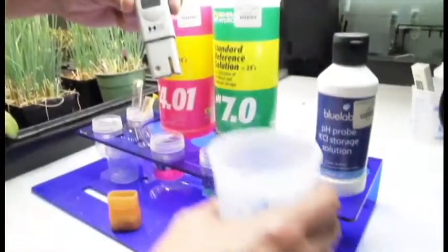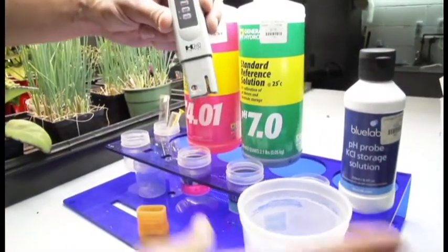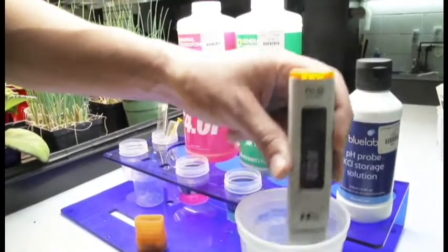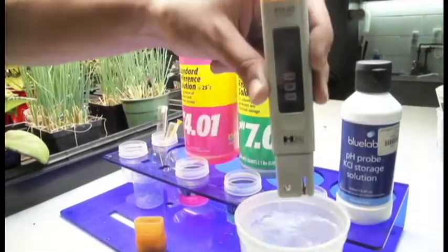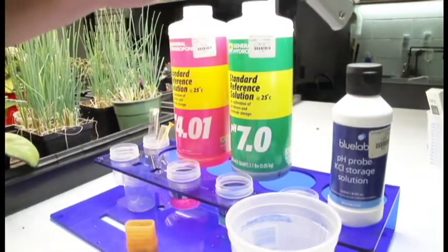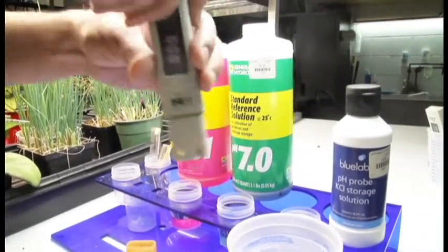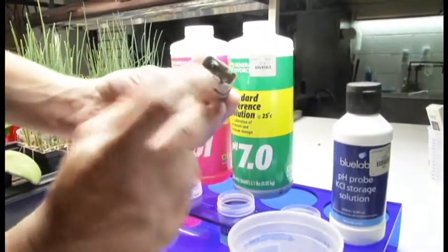I have a handy little cup of fresh water here. I'm going to use that to rinse off my storage solution. I'll go back over that at the end of the video. So now I'm just going to give it a little shake to get as much of that off as I can, without tapping it on anything to damage the components.